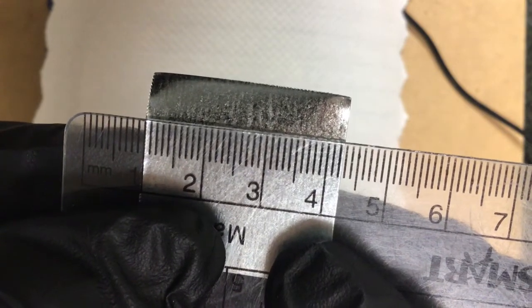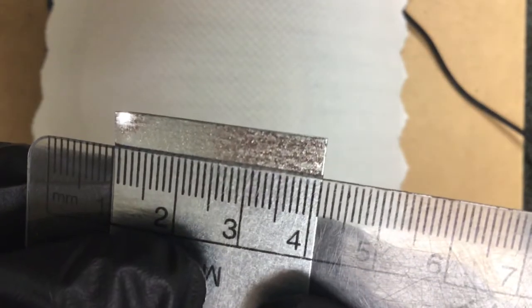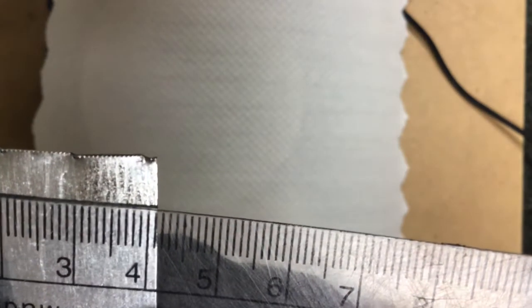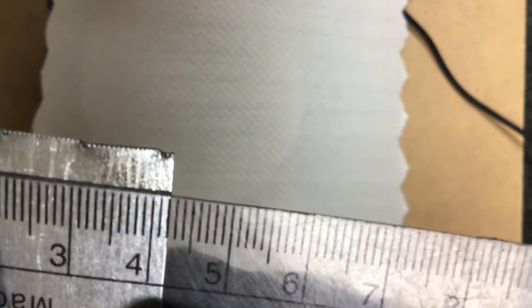Again, go to the nearest tenth. That would be the length, and then here's the width. And then finally, trial 4. Let me get this organized here a little bit.